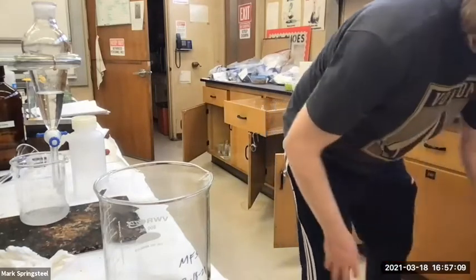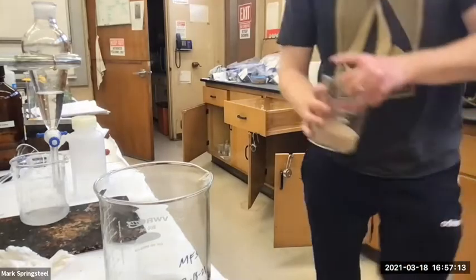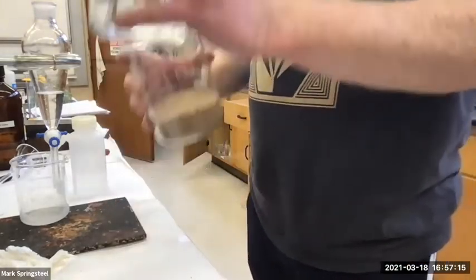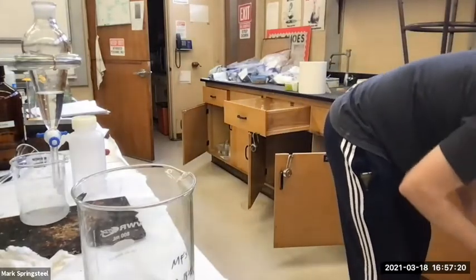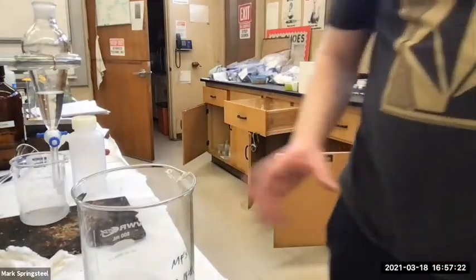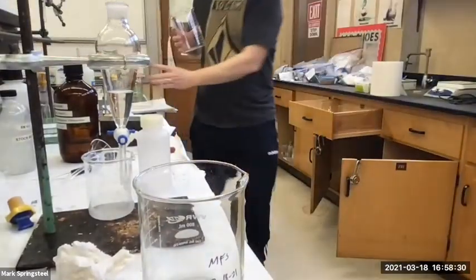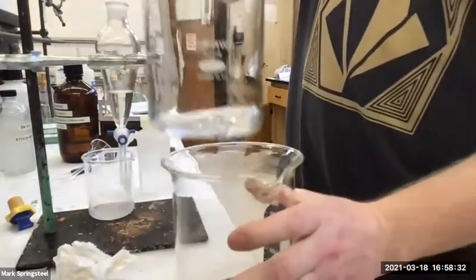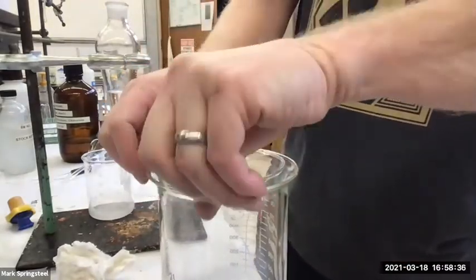I'm raiding all the lockers that you might have been in. Big enough? I don't think this one's the same size. Yeah, they're both 800. Actually, I think I gotta go into the other stock room to grab one, so I'll be right back. Okay, let's see if this one's a good size. Yeah, I think that's gonna work pretty good.